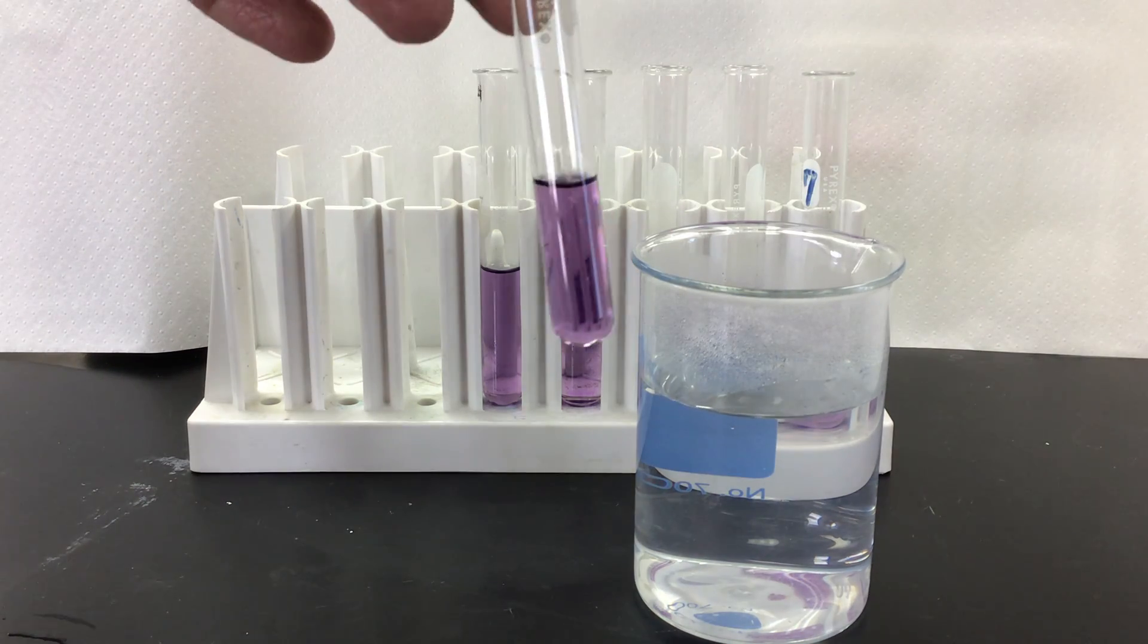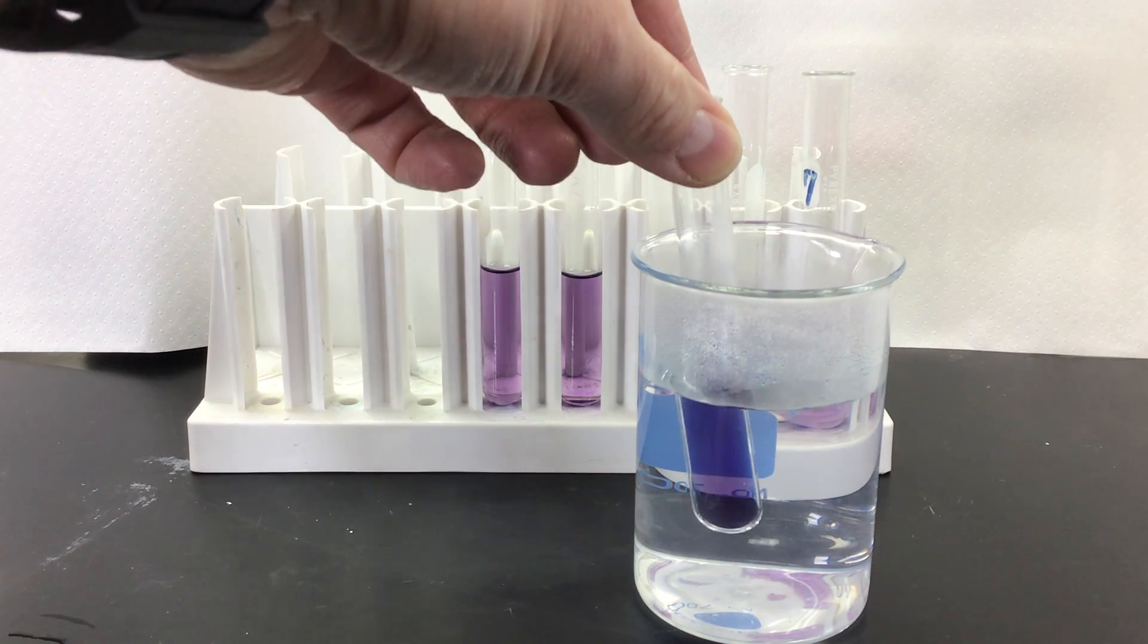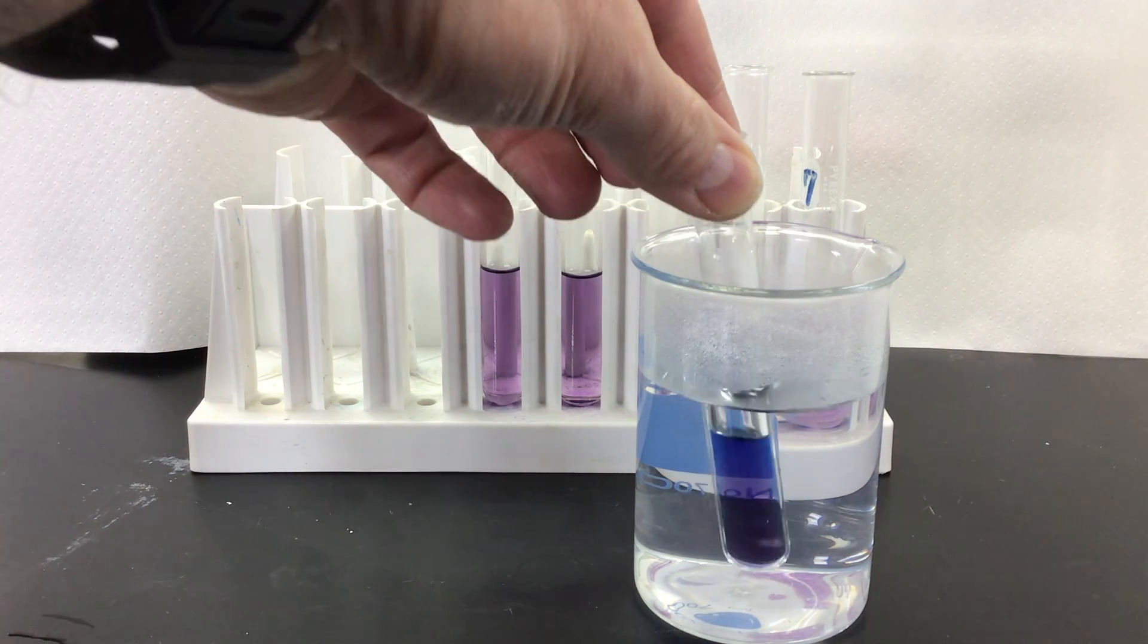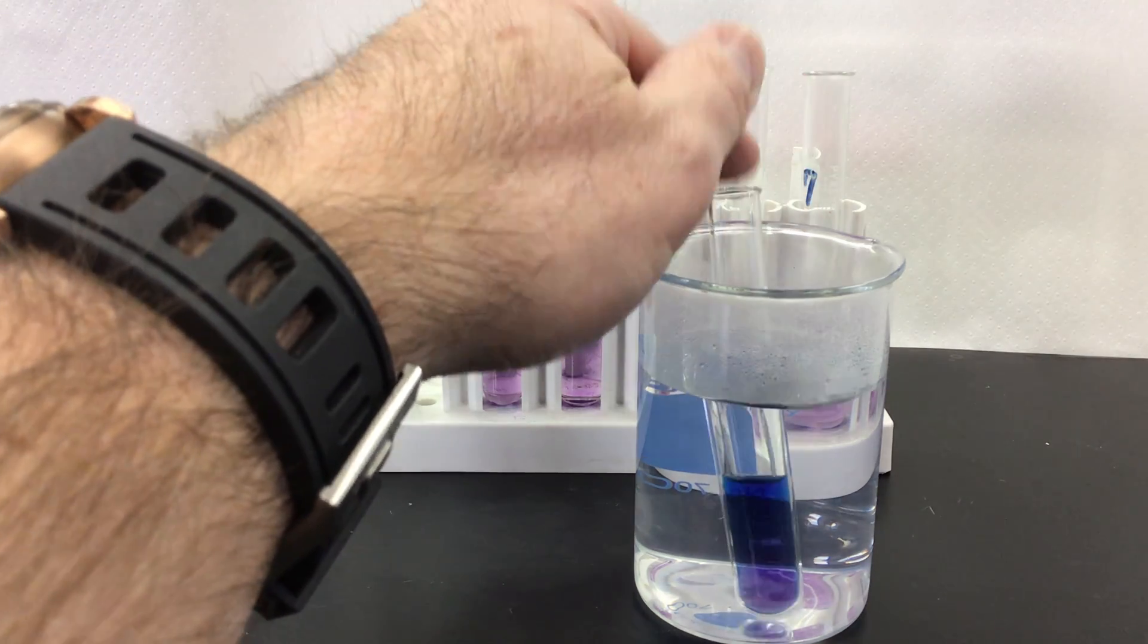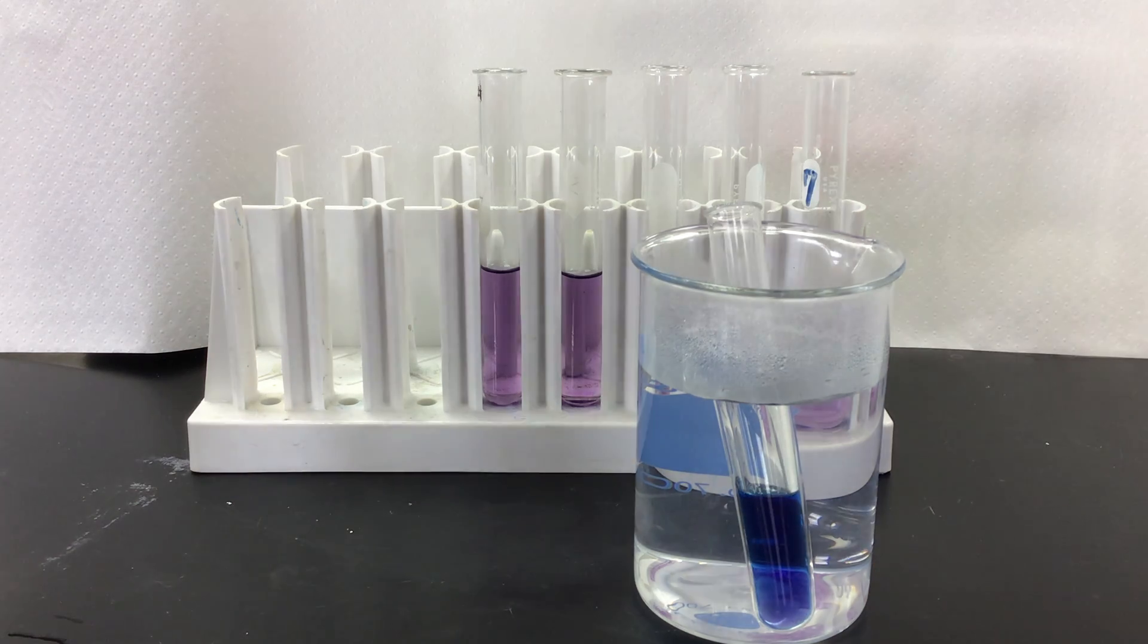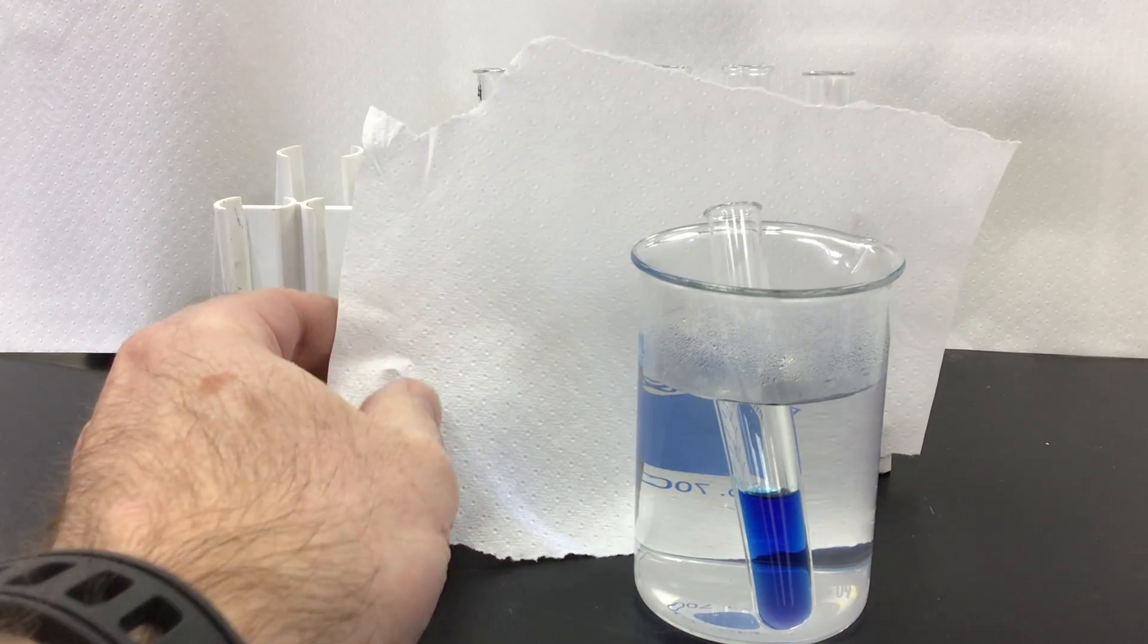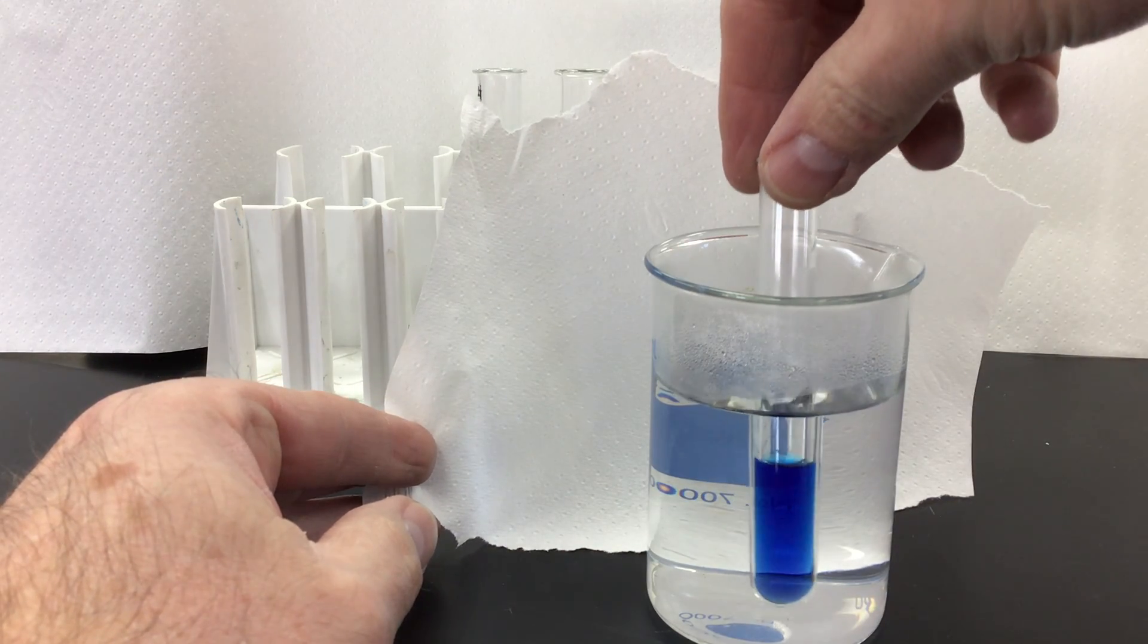I'll take my purple solution here and hopefully you can kind of tell what is going on there and the color change. Let me see if I can get a little bit different piece of paper here so you can see that color change a little bit better. Hopefully you're seeing that it is turning blue. It's definitely turning blue there.